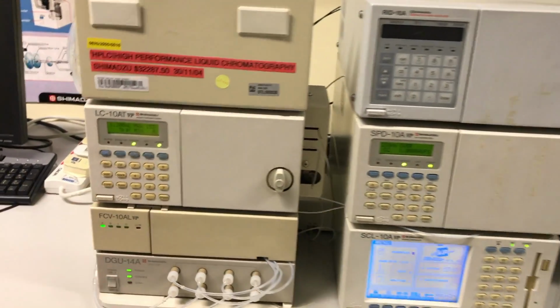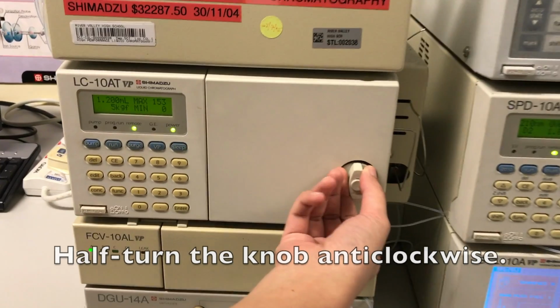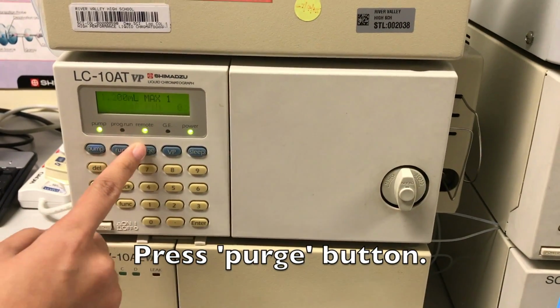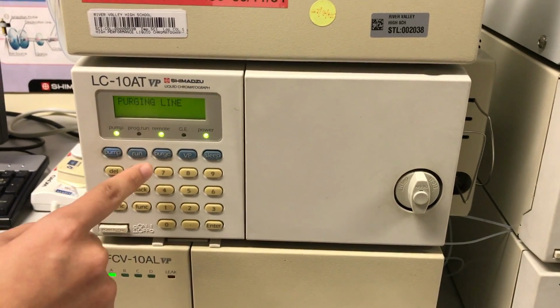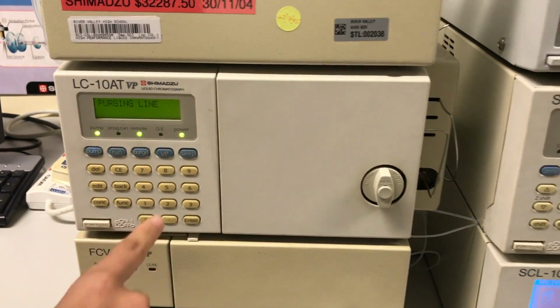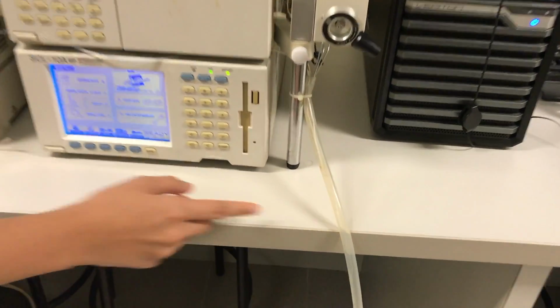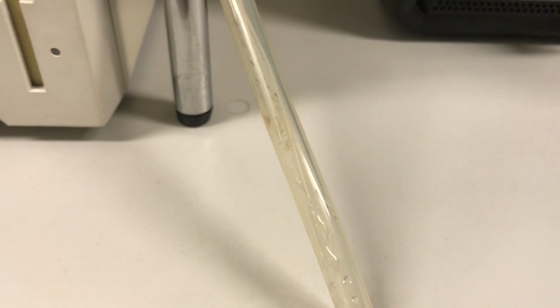So before you do any sampling, you have to purge the machine. So half turn the valve, make sure the word drain is facing on top, and press purge. So once you press the purge button, the solution will be coming out from this side. So this will take place for about 5 minutes.